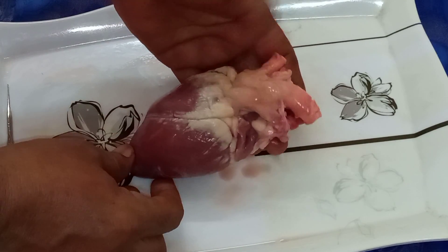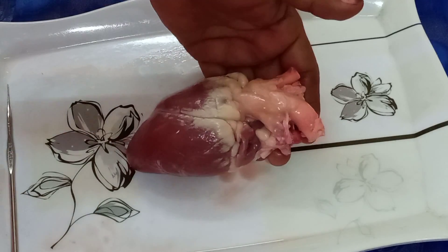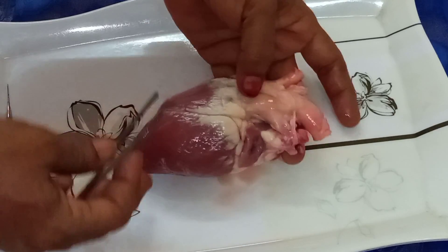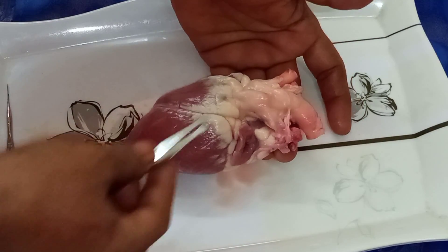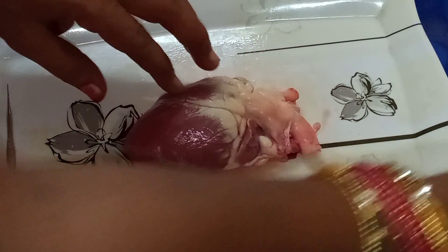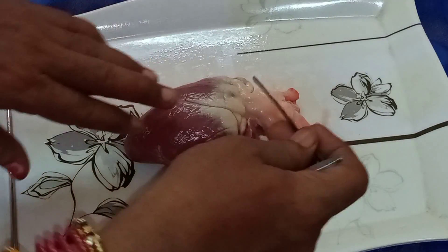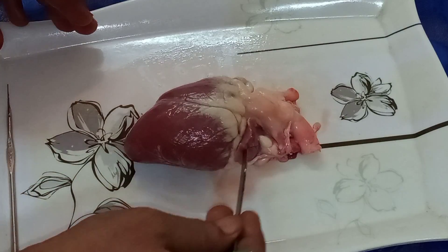It's the structure of the mammalian heart. Let us learn about the external structure. You can observe that the shape is pear-shaped and the outline is triangular. The posterior region is narrow and the anterior region is broader.